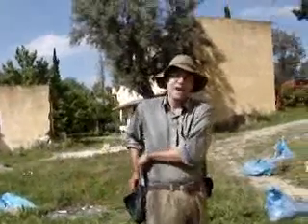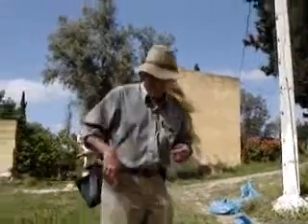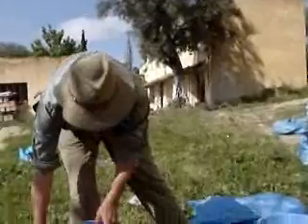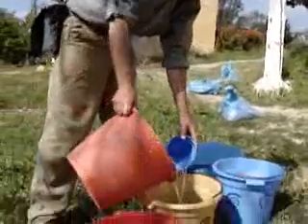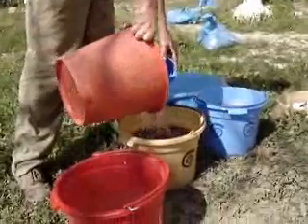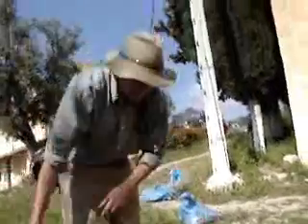What we do is add water and stir. We have a dry sample there, and we simply add water until the bucket is nearly full. Here's one that I did earlier. Once we've got our water in there, we simply stir.